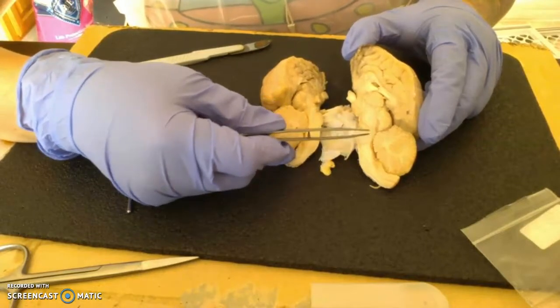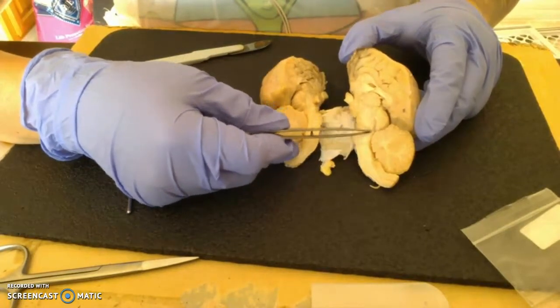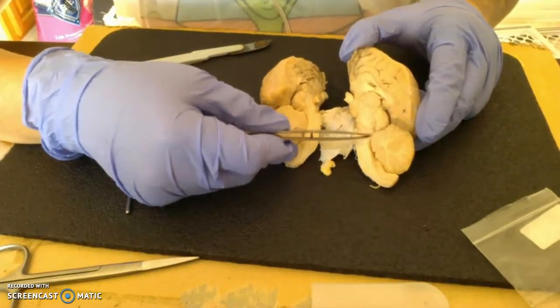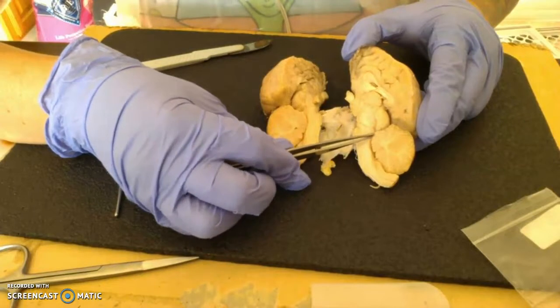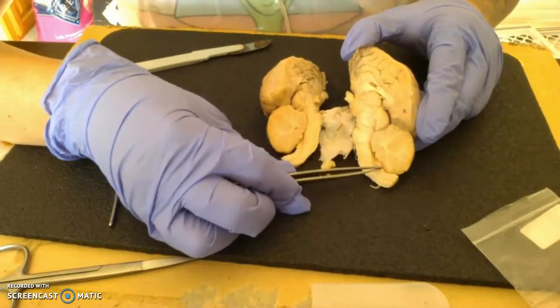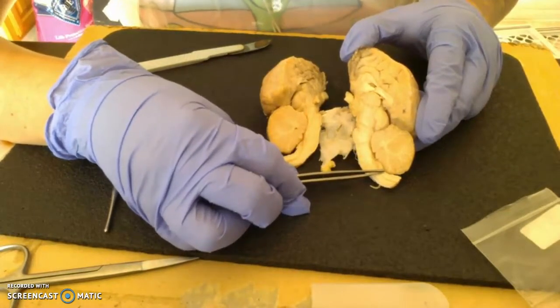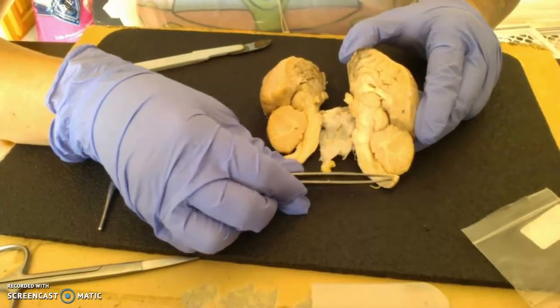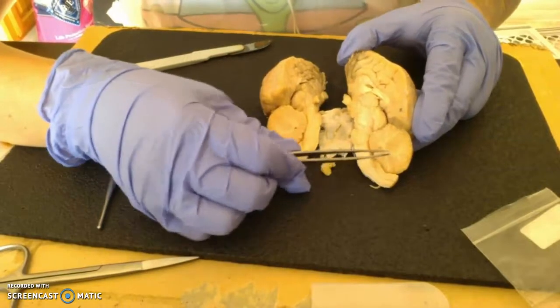And then as we approach, you can actually see where the pons forms, the little hump right here. So we'll have pons, and then from about the beginning of the cerebellum to about the end of the cerebellum, we're going to have the medulla oblongata, and then leading into the actual spinal cord.